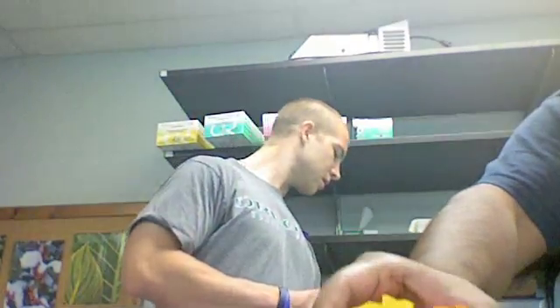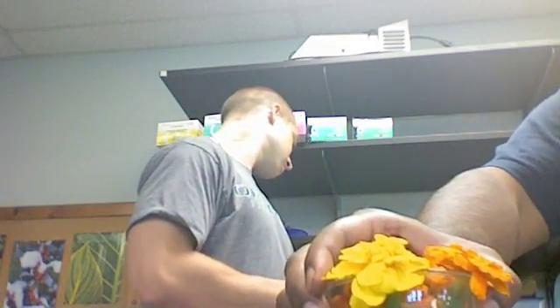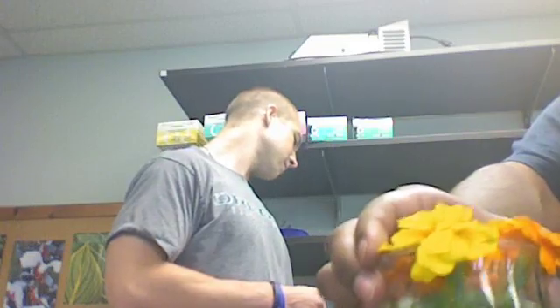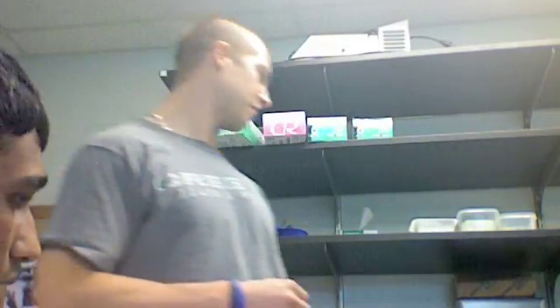This is the marigolds. We saw the chromoplasts and the carotenoids in the chromoplasts. And this is an African violet where we looked at the anthocyanins in the vacuole.